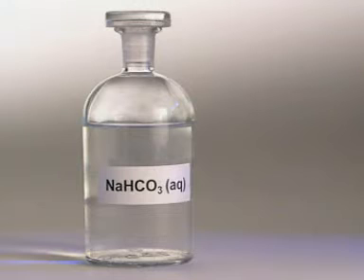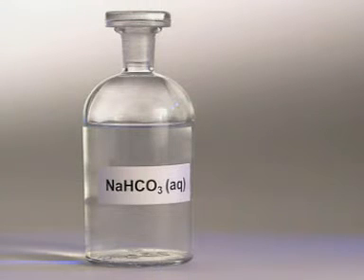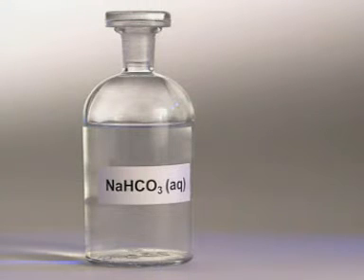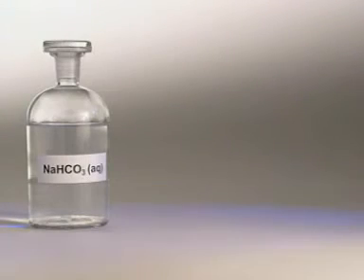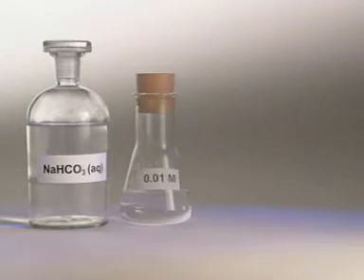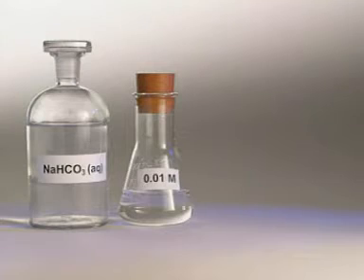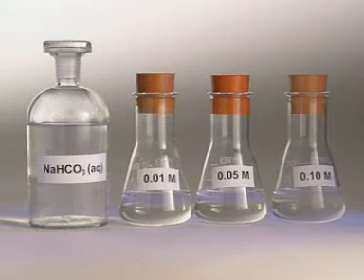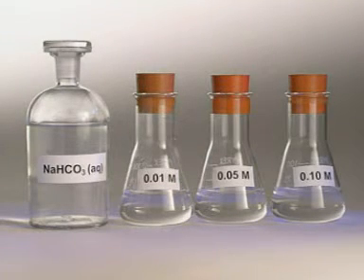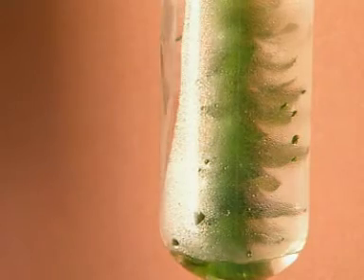A good source of carbon dioxide is sodium hydrogen carbonate solution. The greater the concentration, the greater the amount of carbon dioxide available to the pondweed.